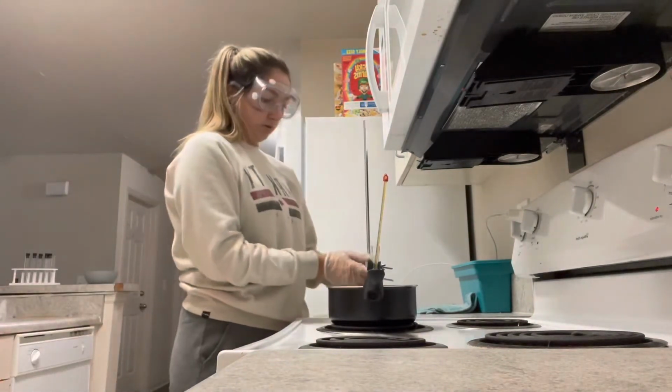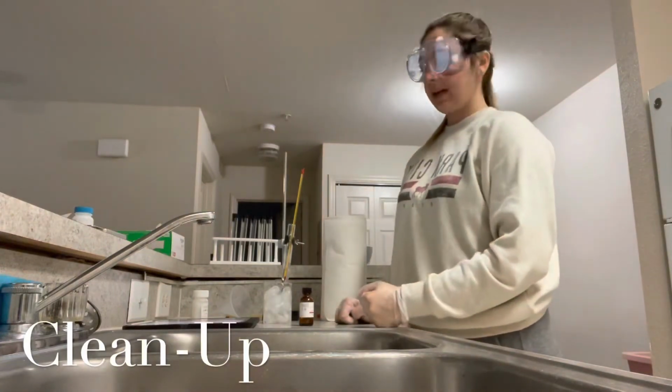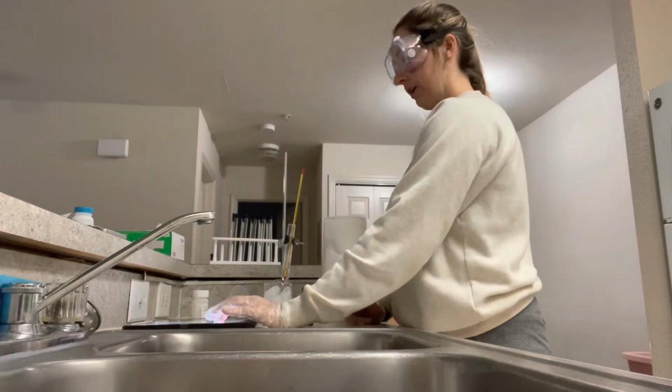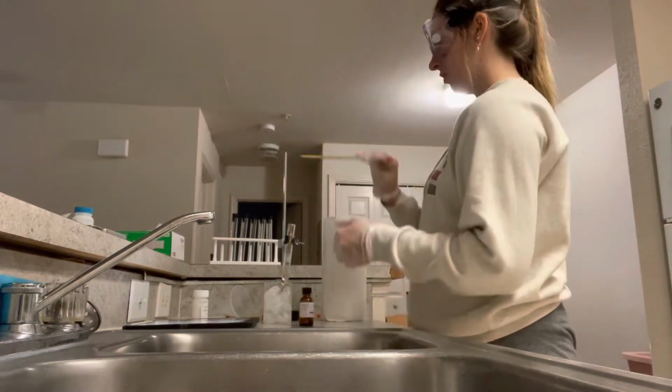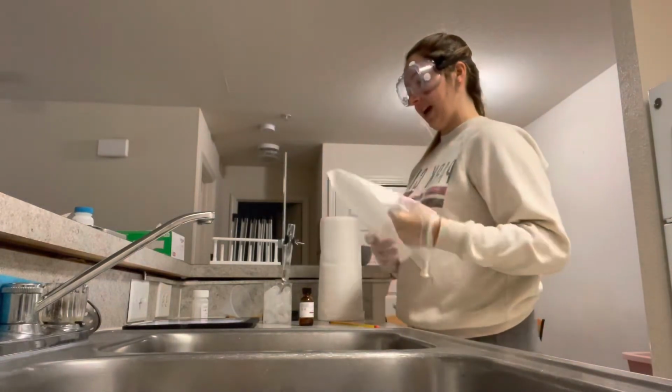Okay, now that my solution is completely melted, I will start the cleanup process. What I will first do is remove the thermometer and wipe it with a paper towel coated with acetone.